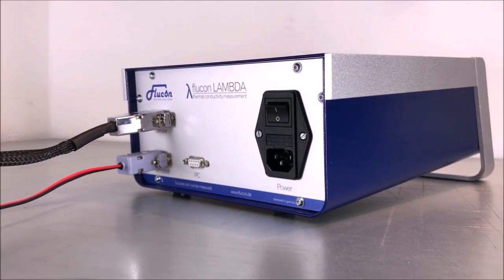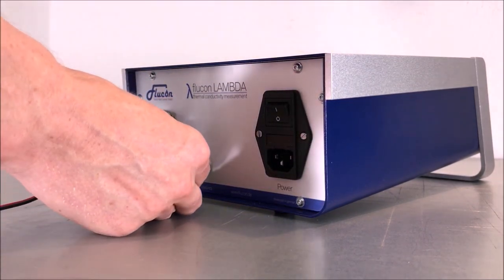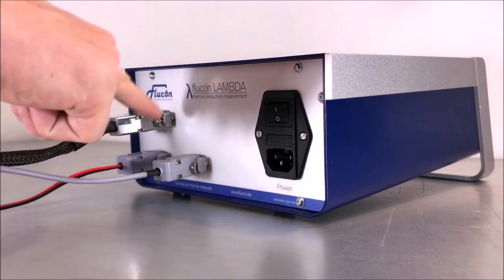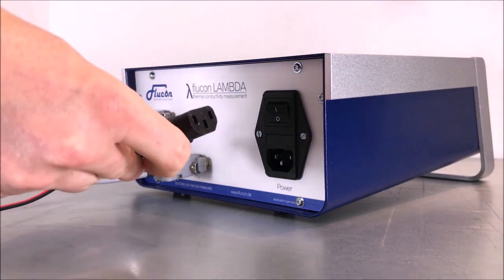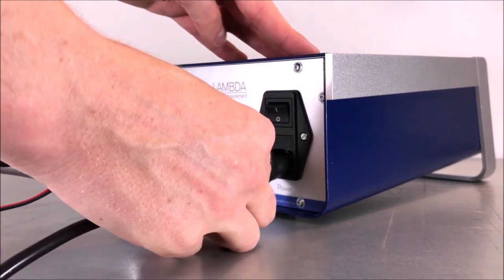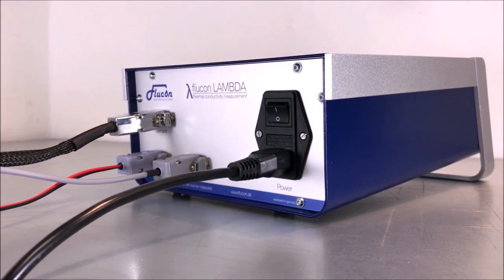Before adding the power supply, plug in the PC cable and tighten the screws of the connector. Now it's time to add the mains cable for power supply. Simply plug it in. Now your Lambda meter is ready to be switched on.